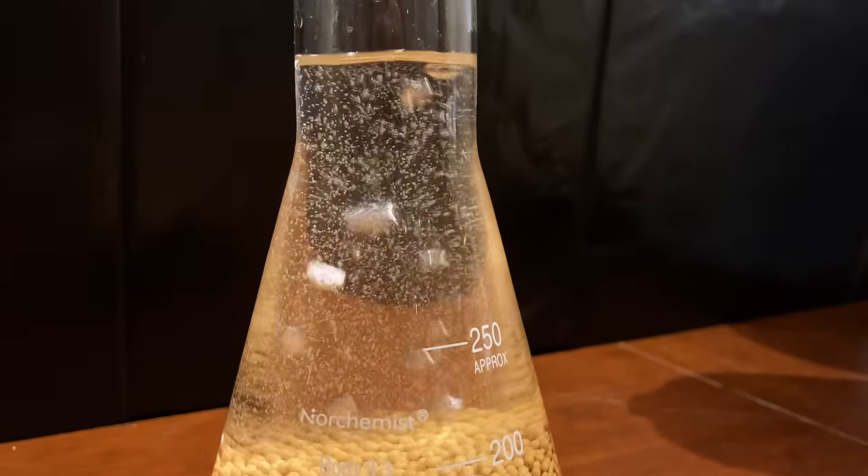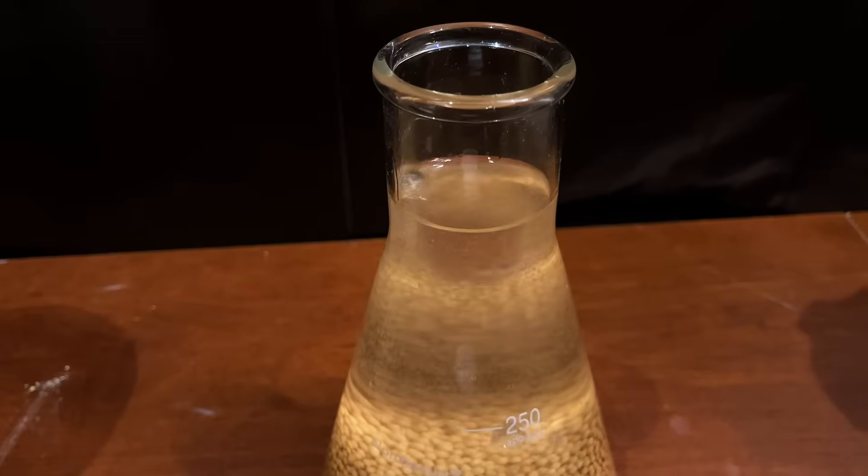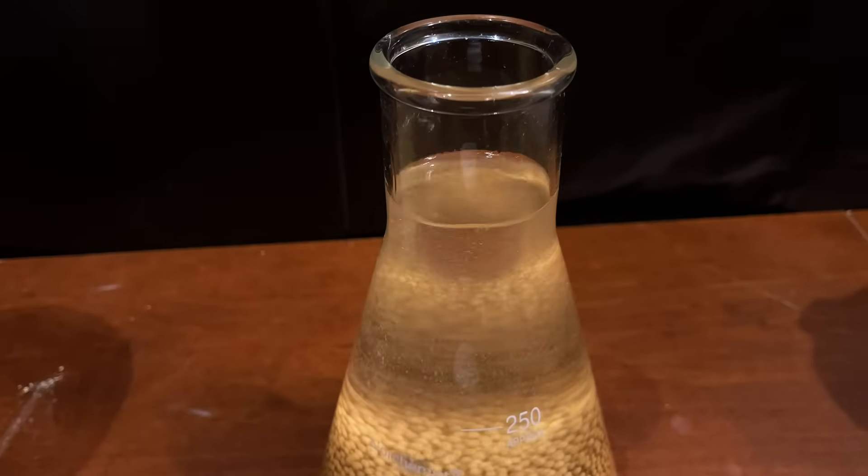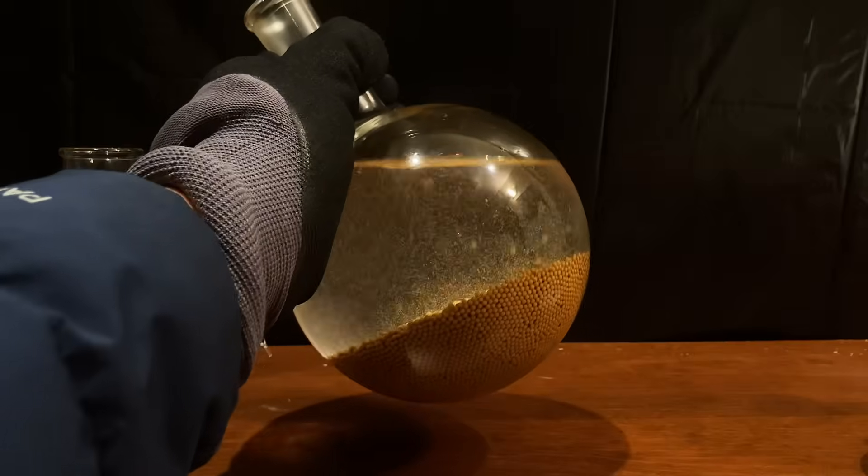Now after a few hours, for me overnight actually, the solutions will stop bubbling and basically all of the water left. Now I did run into some issues with my hot plate stirrer breaking and not being able to distill it, but long story short, I got a new one a while later and let the drying phase take longer.